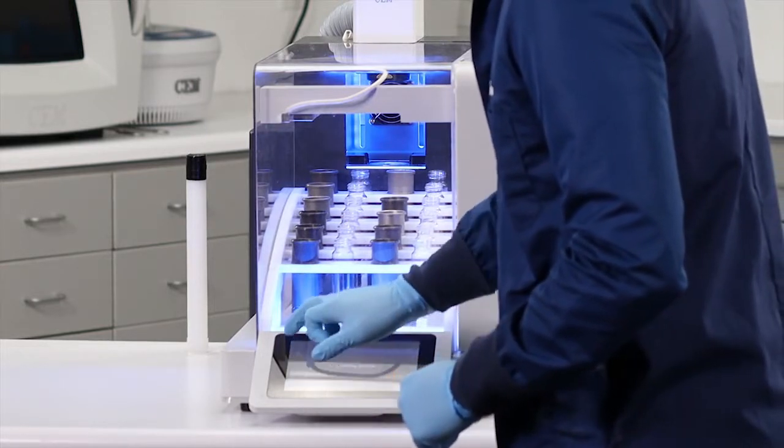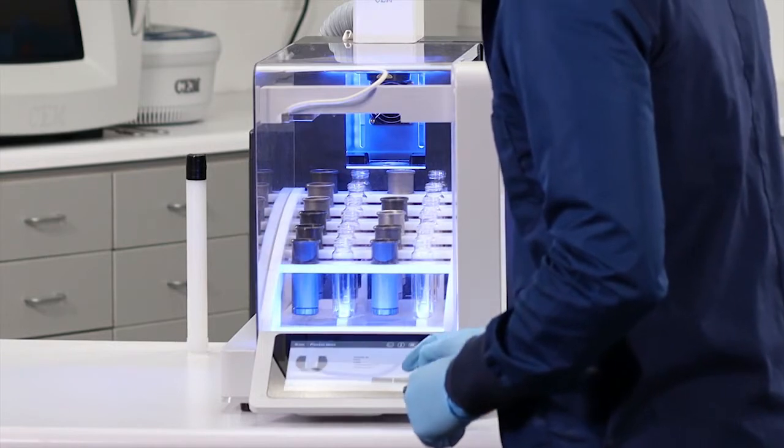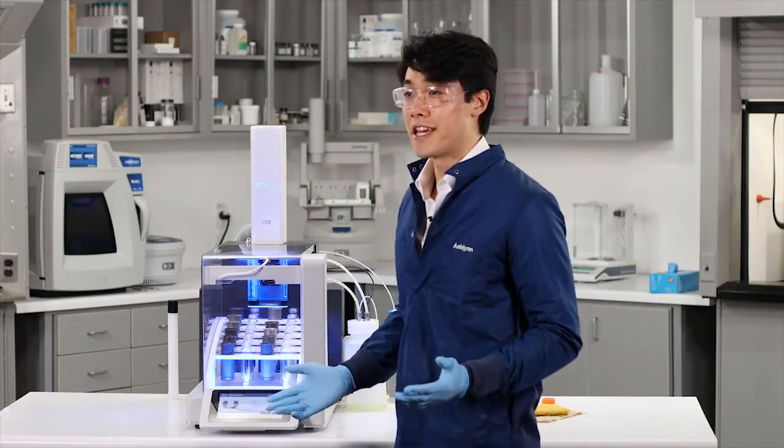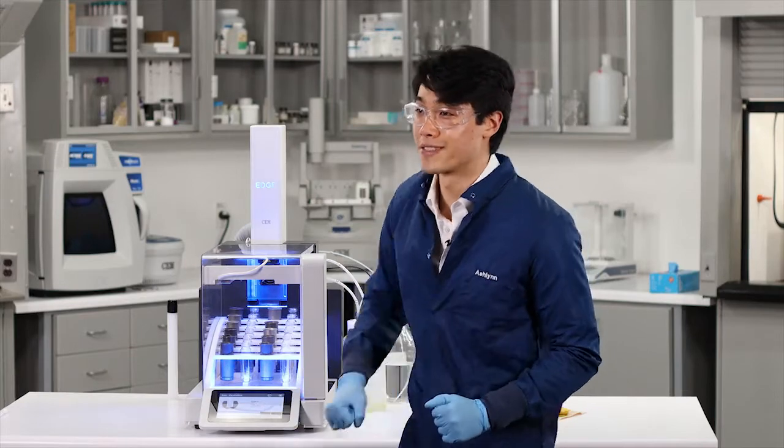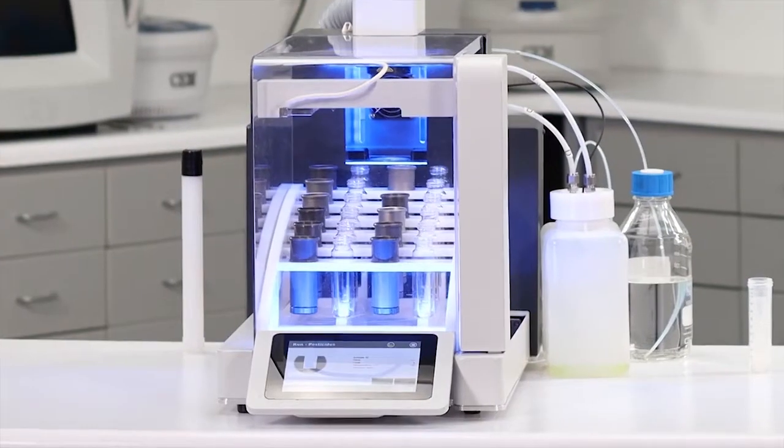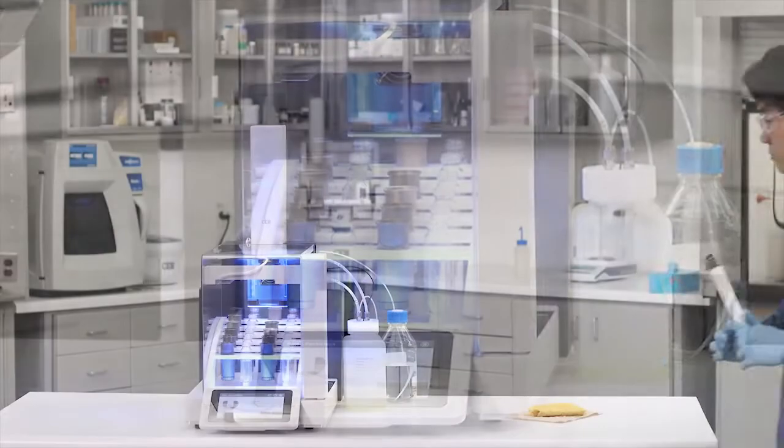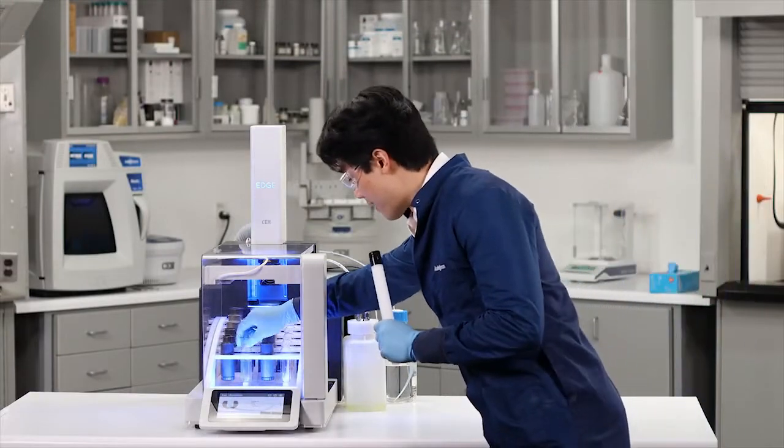I'm going to load my method, press start, hit play, and that's all it takes folks. I'll see you in a few minutes. Ah, look at that Edge.